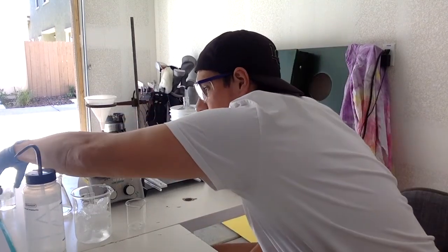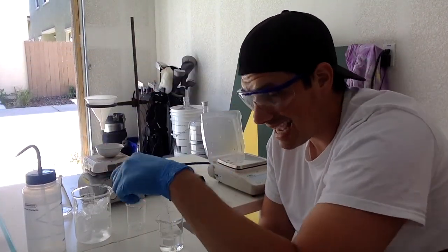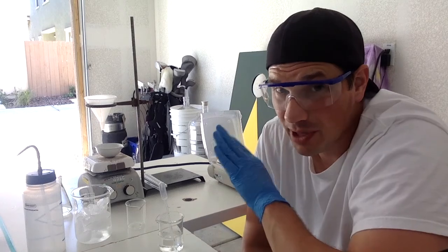And we're kind of just gonna do that same dance again. So I have my water. I'm gonna put it back into this ice bath right here, let it cool down. Once it's cooled down for, again, like 10 minutes, what I'm gonna do is let it dry for a couple hours after that, and then I'll show you the next step. I'll tell you how much we actually get out of this, and then pour through some calculations with you. So we're gonna let this sit for about 10 minutes, and then we'll be back in about 2 hours.